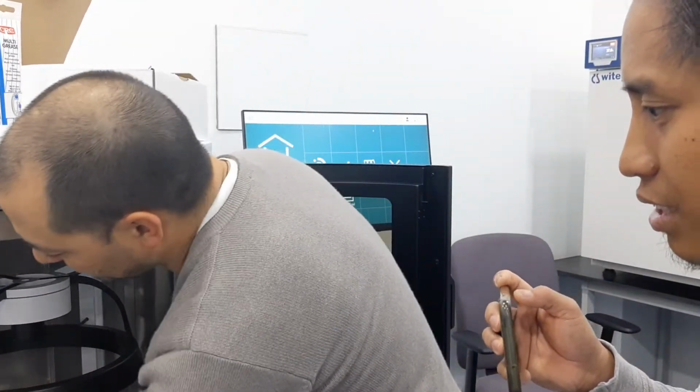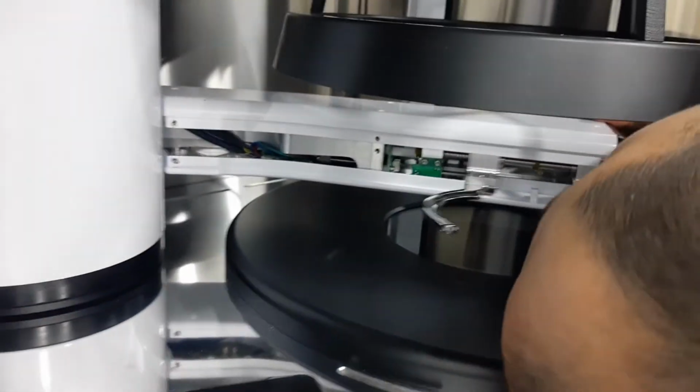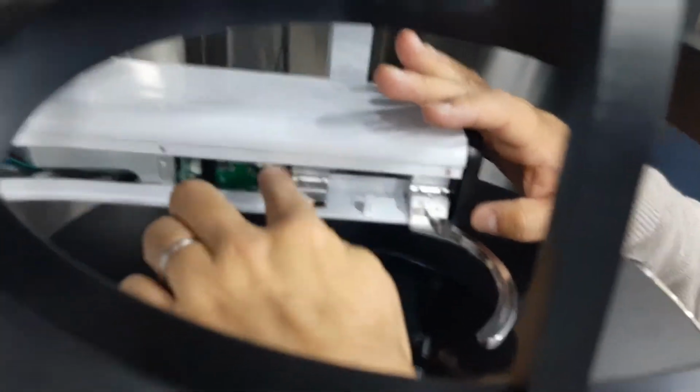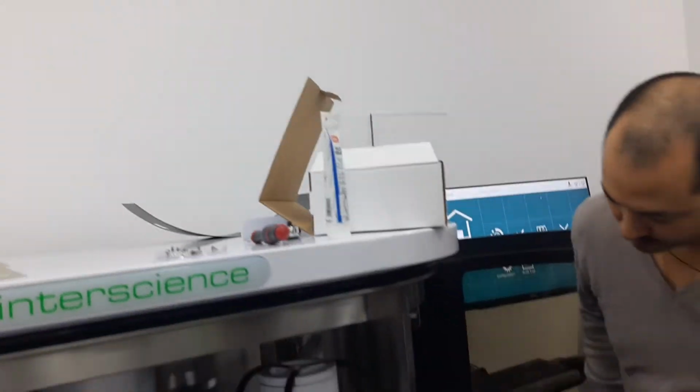But also, maybe I can show you here on the axis. You should put some grease too. And maybe it's better if I take off the lower cover. I don't know if it's necessary, but here you can see that there's linear guides, and it's ball also. So you should put some grease here. Also, there's a screw behind. You should put some grease also on the screw. So I think we provided a little brush to put a bit of grease. Good. This is much easier, much easier.